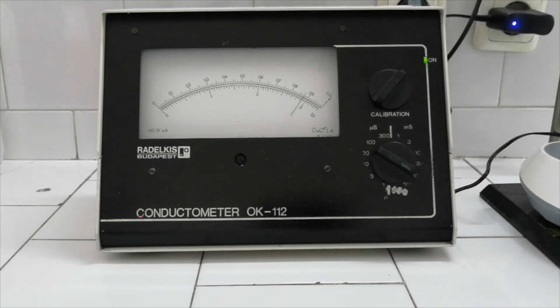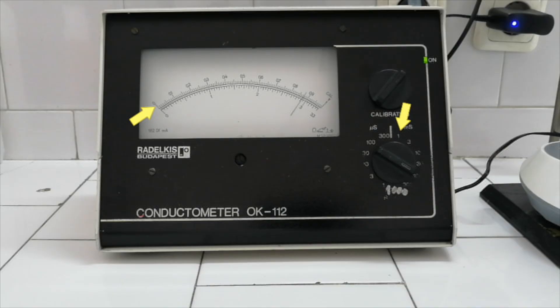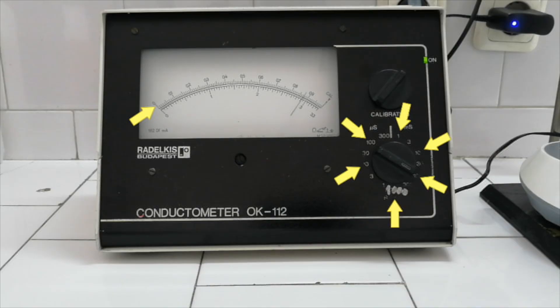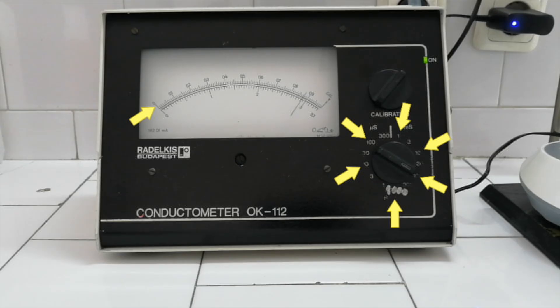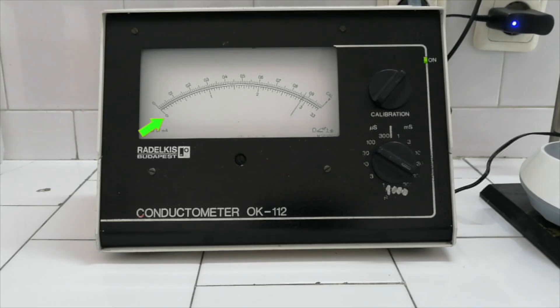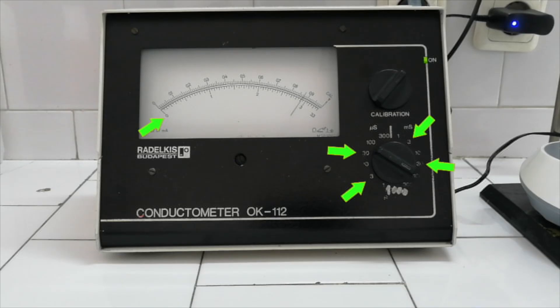If the measuring range starts with digit 1, you will read the conductance on the upper scale, whose maximum value will be 1, 10, 100 or 1000. If the measuring range starts with digit 3, you will read the conductance on the lower scale, the maximum value being either 3, 30 or 300.